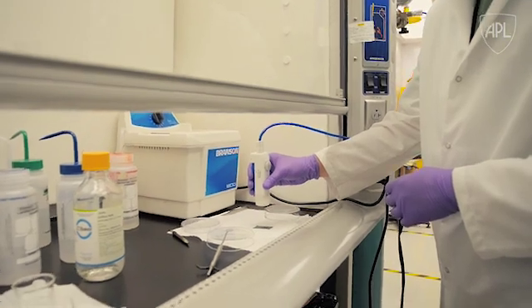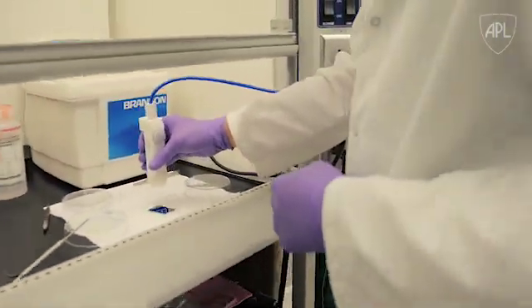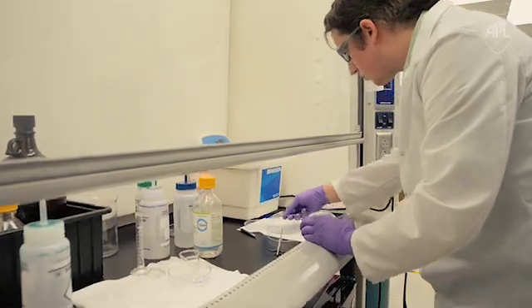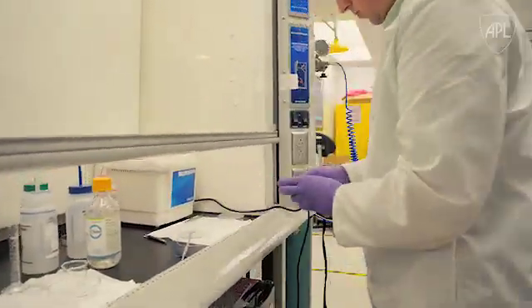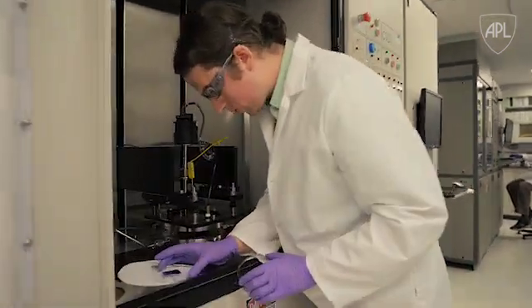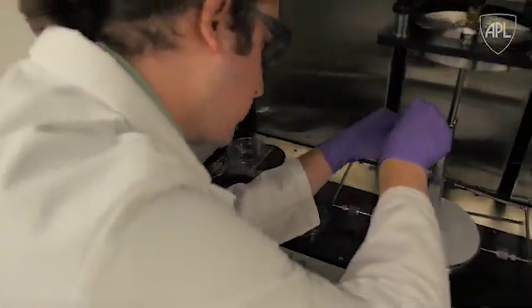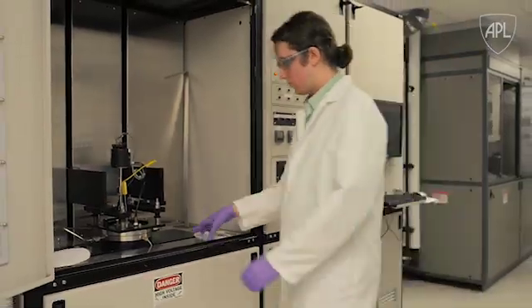After cleaning the wafer, we blow dry in ultra-high purity nitrogen and then move into the reactor as fast as possible to avoid any potential surface contamination. We want to keep that surface pristine prior to loading into the reactor chamber where thin-film deposition will be initiated.